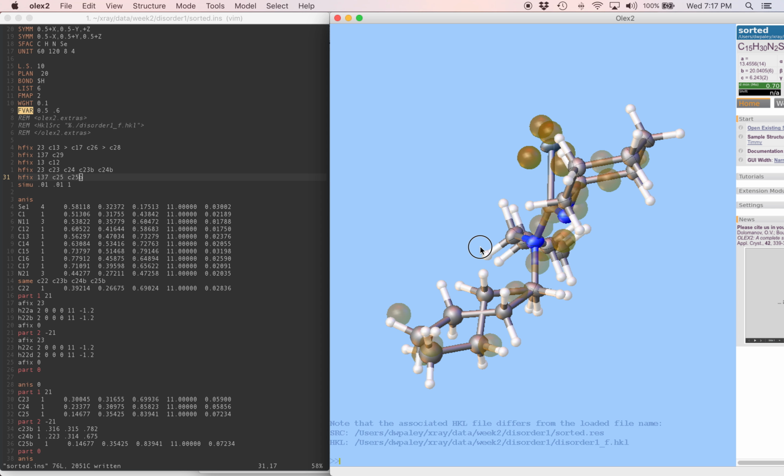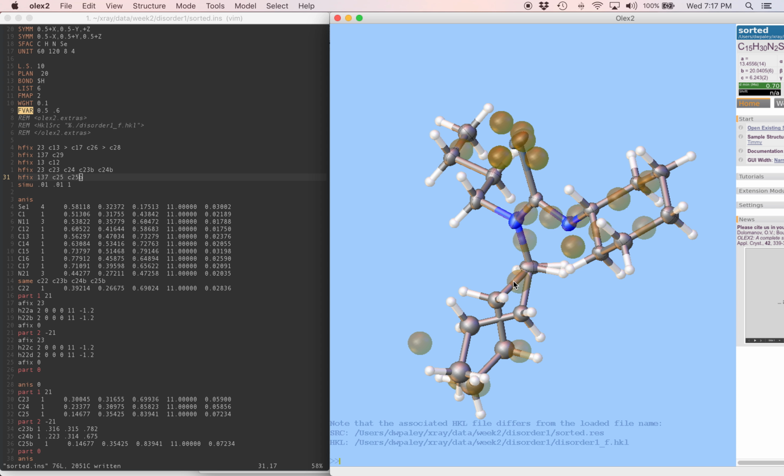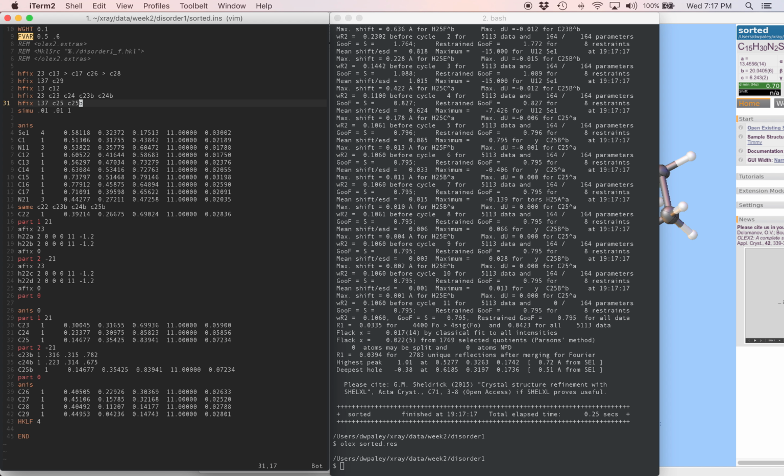Okay, still looking good. There's no surprise there. We know the hydrogens are going where we tell them to, so there's nothing that we would be surprised by after just adding hydrogens. We do need to make the disordered atoms anisotropic, and to do that, all we need to do is get rid of this ANIS 0 instruction that we put to stop them from becoming anisotropic.